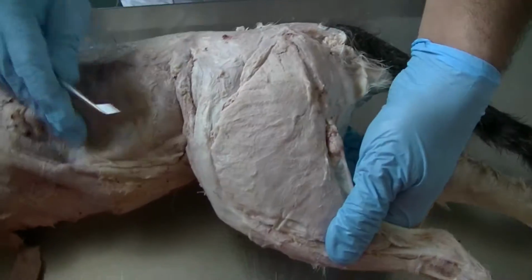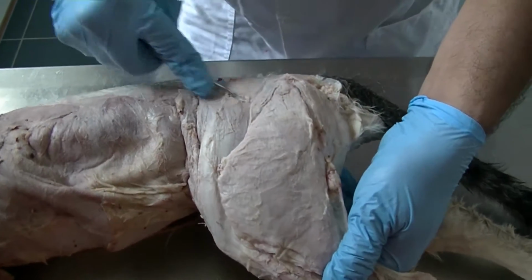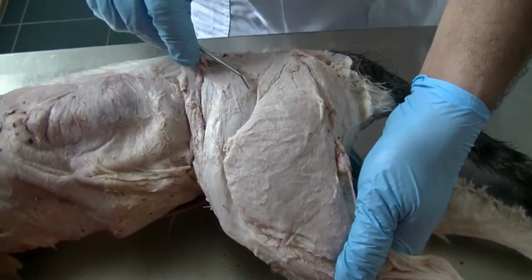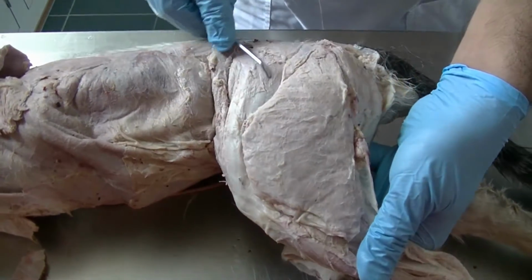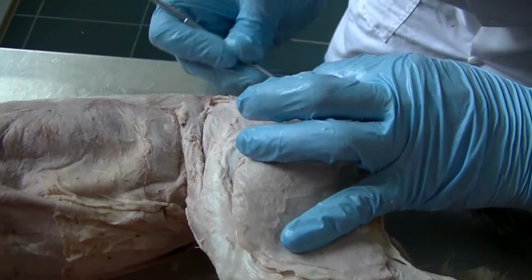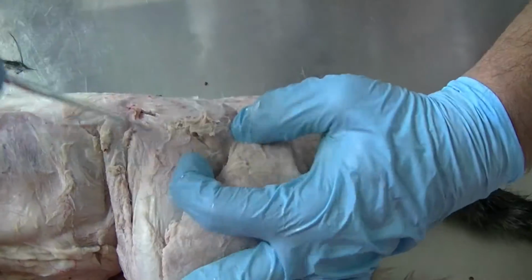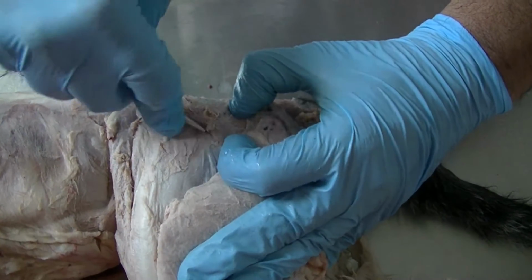Okay, so what we see here again, the gluteal muscles separating the middle gluteal from the tensor fascia lata, the triangular muscle here which continues further into the fascia lata, that is the tensor fascia lata, the cranial crural abductor. After reflecting the cranial crural abductor, we are going to separate the superficial gluteal to expose the middle gluteal completely.